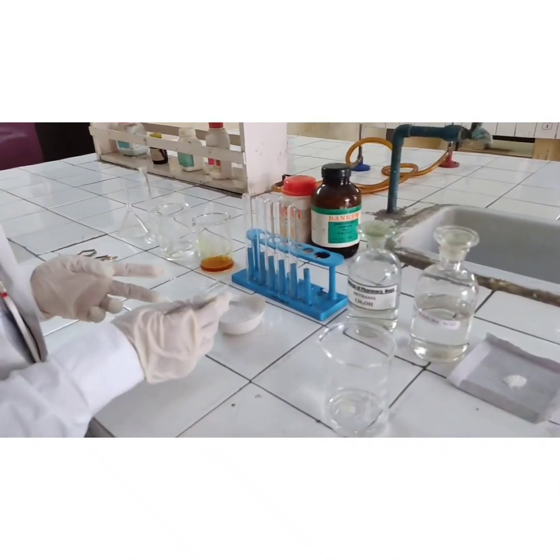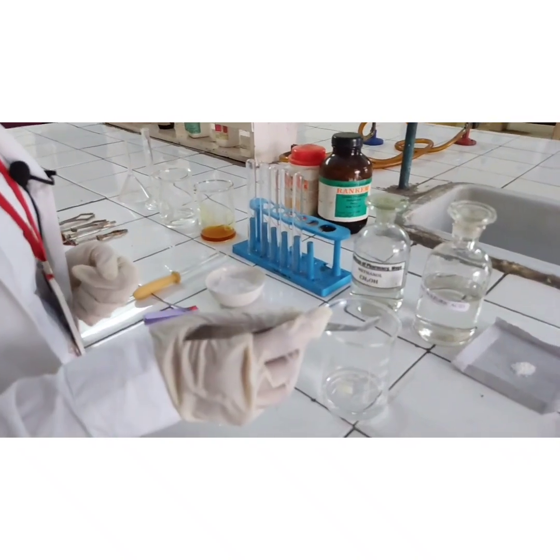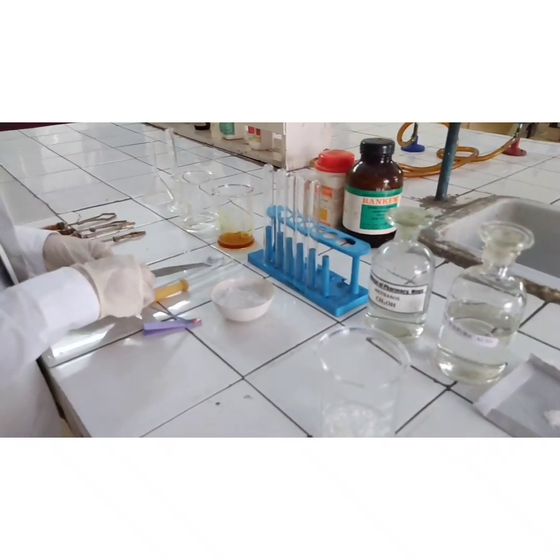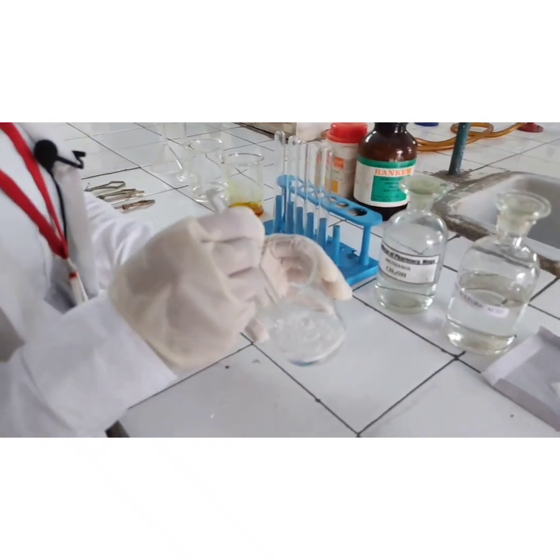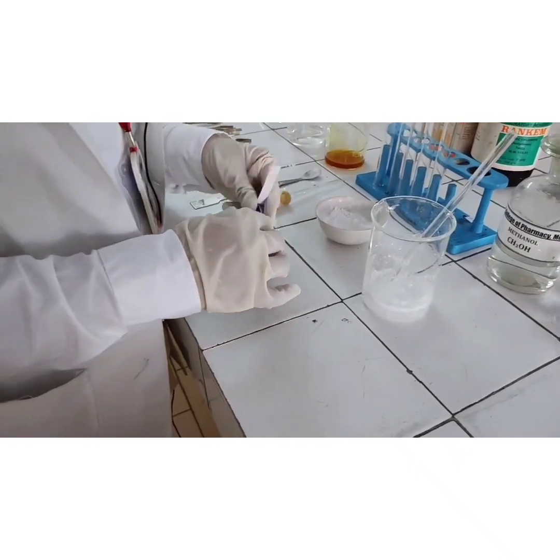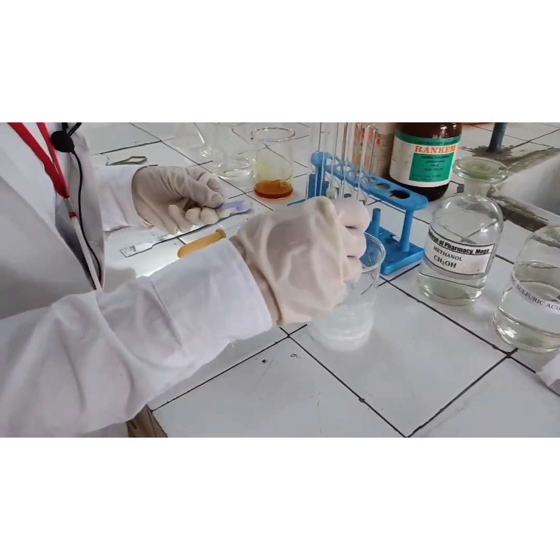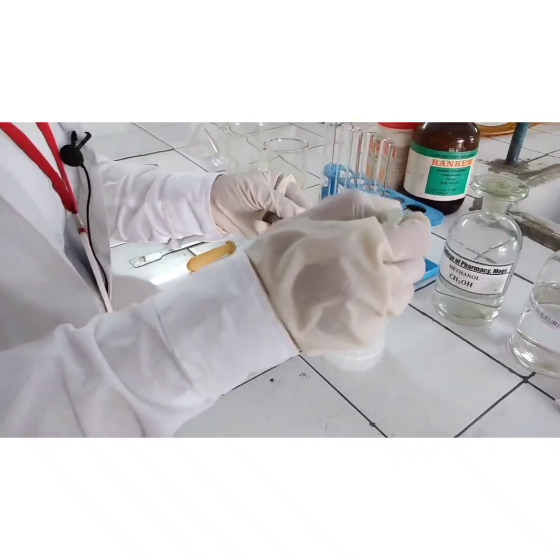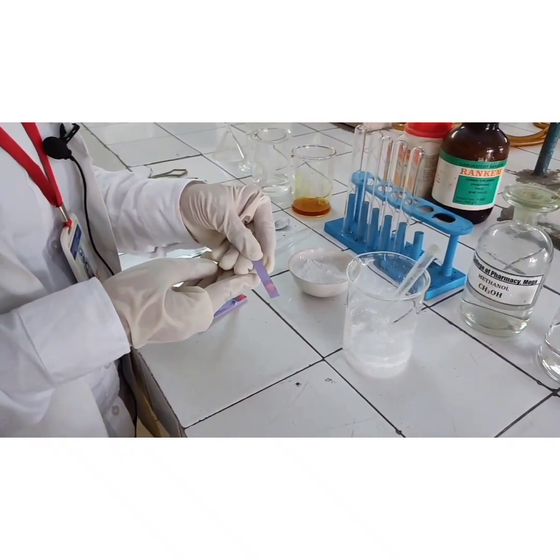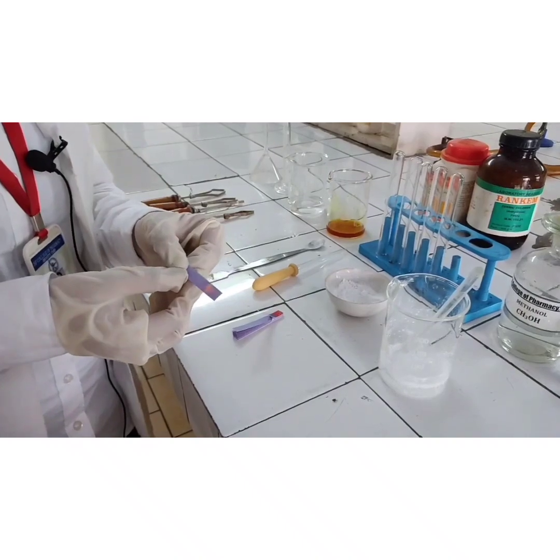Now we will be performing the blue litmus test. I will prepare a solution of the unknown sample in water and apply it to blue litmus paper. We can see that the color of the blue litmus has changed to red, which indicates that our compound is acidic in nature. Our compound could be a carboxylic acid or it may contain a phenolic group.